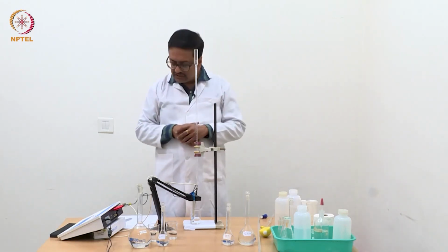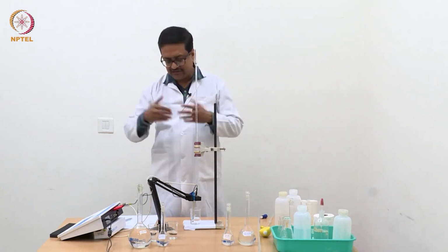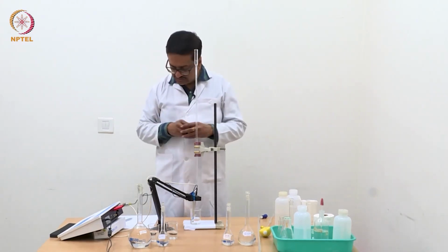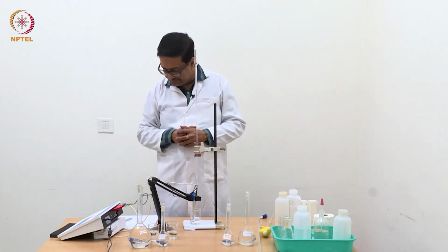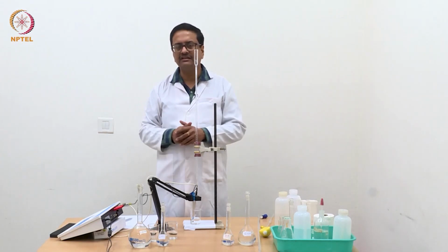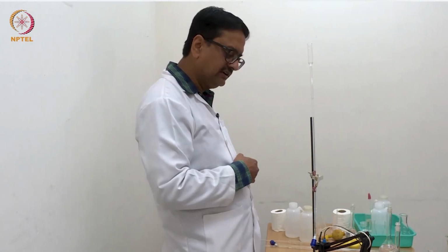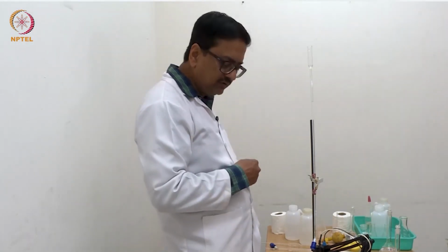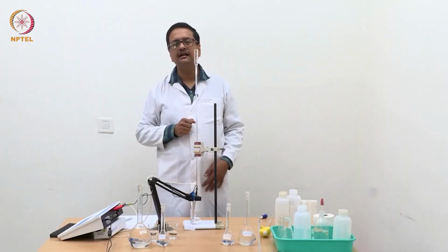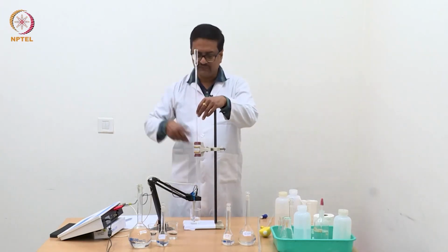We are about at the equivalence point now. We have taken 10 ml of HCl, and that 10 ml of HCl would consume about 1 ml of NaOH. So in the next few additions of 0.04 ml of NaOH, we should start to see an increment in the conductivity value, which will then indicate the end of the titration, and the equivalence point can be determined using the tangent method.